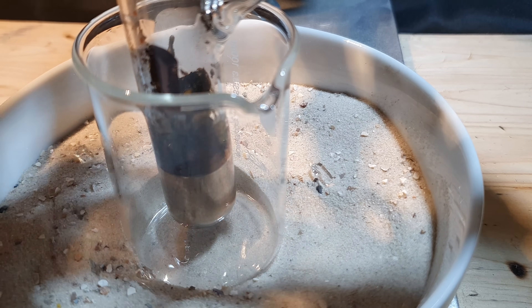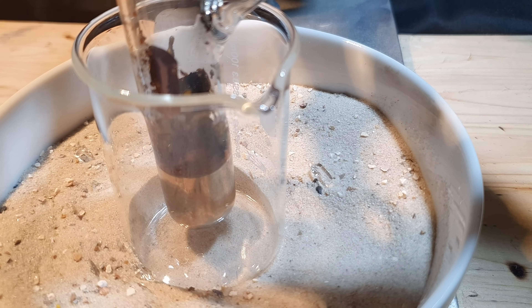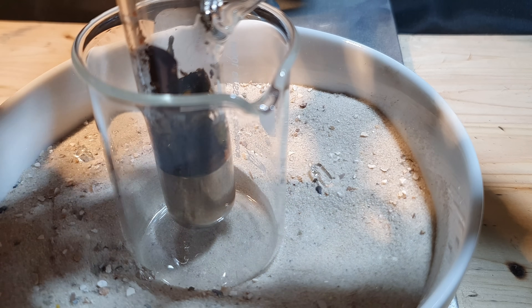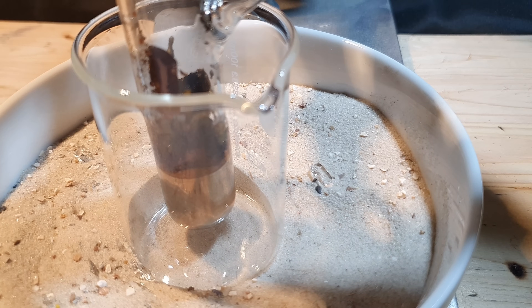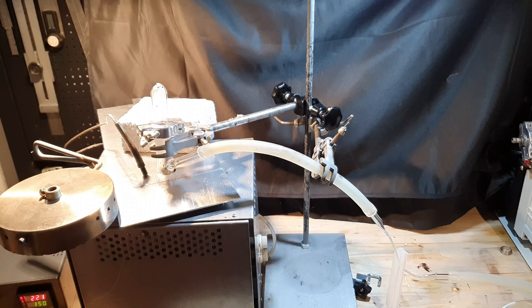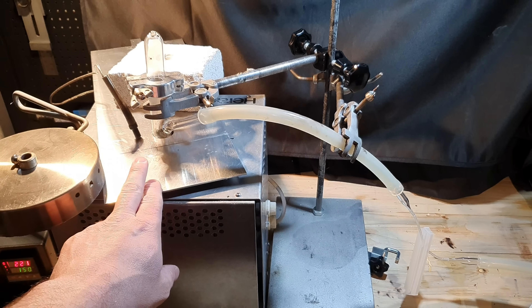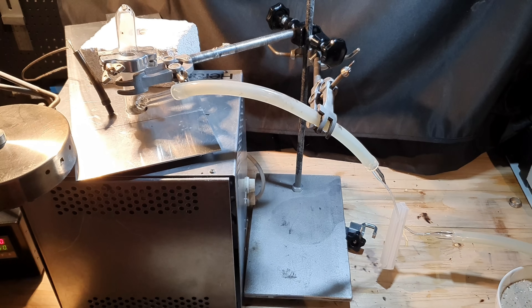I really hope I will be able to get it out of here. In the original paper they ground it with a pestle, and I'm really hoping it won't solidify down here. They said they used a quartz glass tube — this isn't quartz glass, it's borosilicate glass. After about an hour, the cesium turned into a black solid and did not take up any more oxygen, which means it was time to heat the reaction vessel under oxygen atmosphere — first to 100°C, then 150°C, and then 200°C, adding oxygen continuously.